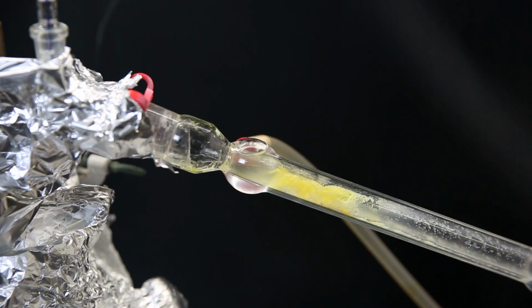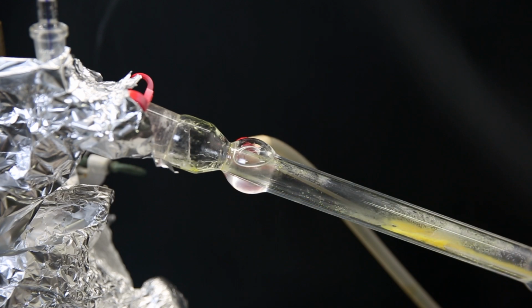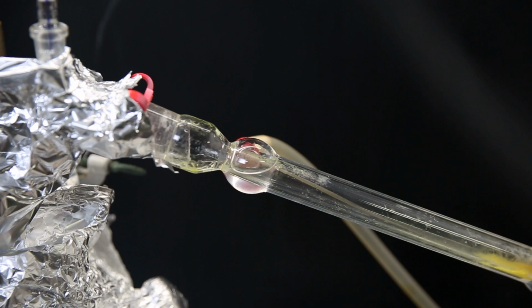The second issue was the annoyingly long workup, with the filtration, extractions, and steam distillation. So I'm gonna cut that short and directly distill over the 2-nitromesitylene, which will also prevent the losses that occur in these steps. So now, the final working procedure.